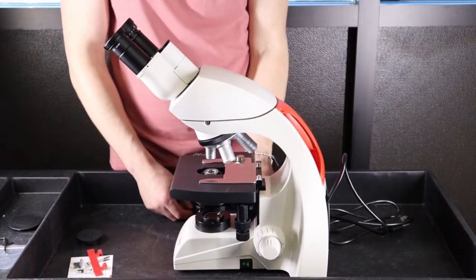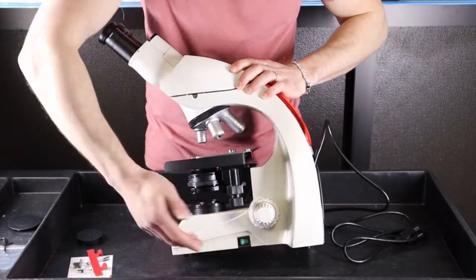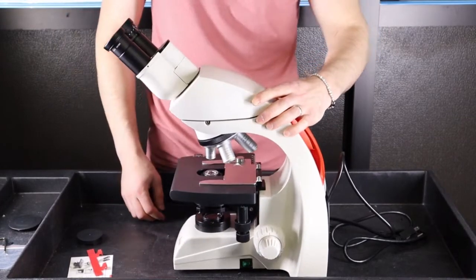Now your microscope is set up. The safety locks are removed. You can plug the microscope in, turn it on, and start to use your microscope.